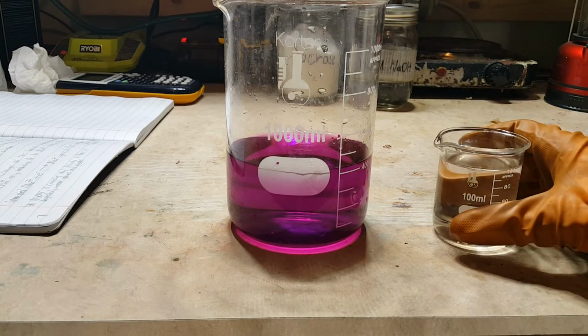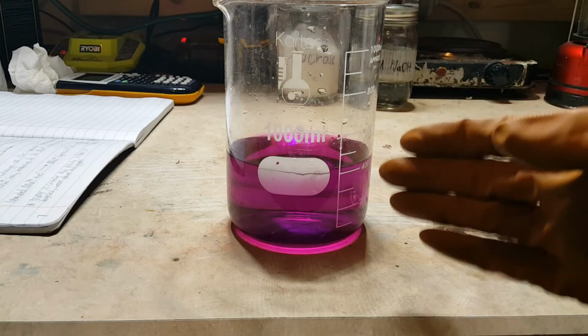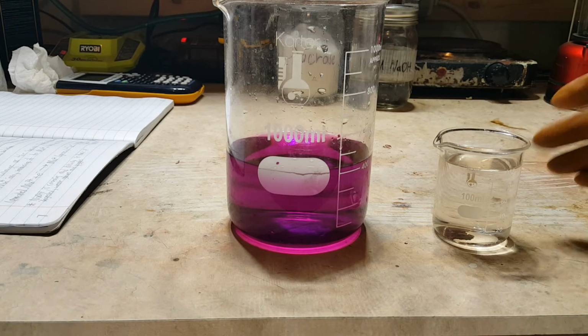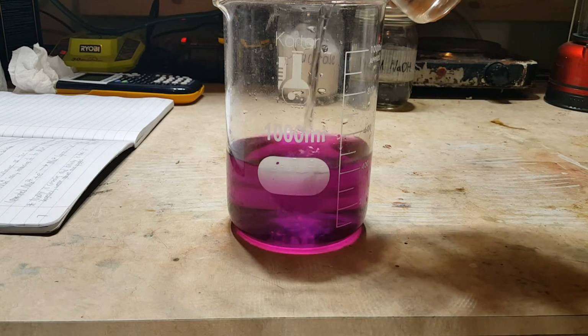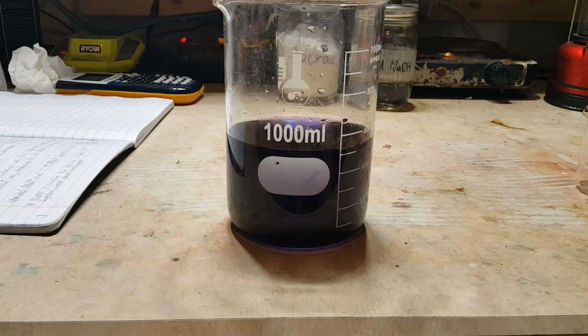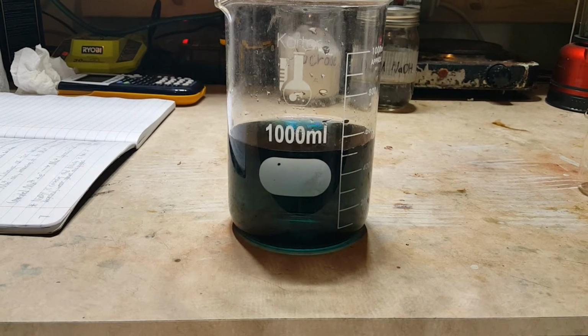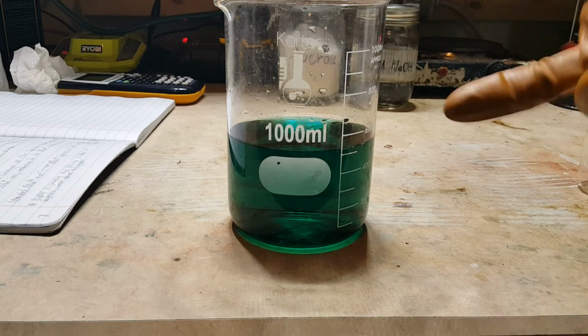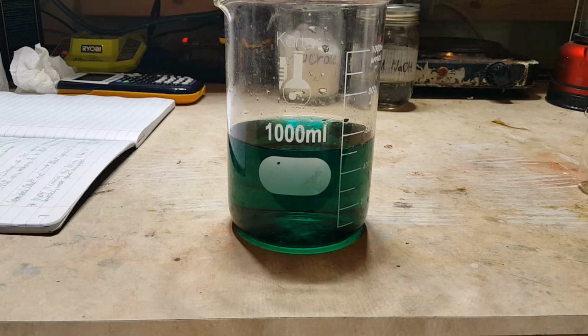So, all we need to do at this point is mix the two solutions, 400 milliliters potassium permanganate solution, 100 milliliters of sodium hydroxide and sucrose solution, and watch the color change. So the manganese has just gone from the +7 oxidation state, which is purple, to the +6 oxidation state, which as you can see is green. Now, the manganese will then go to the +4 oxidation state, although it will do so much more slowly than it went from +7 to +6.